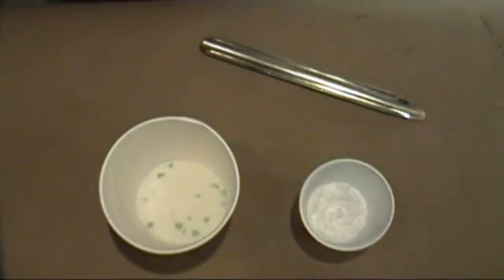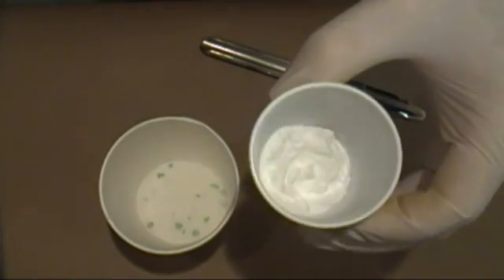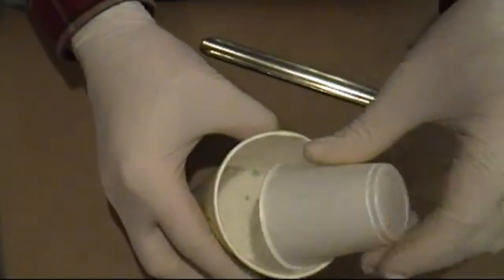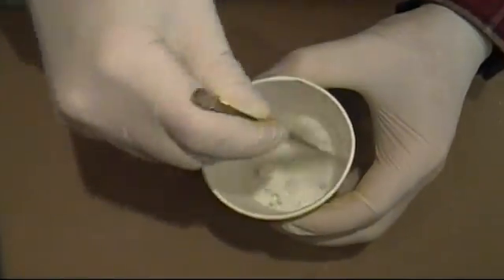Then, get about 30 grams of anhydrous sodium acetate. Afterward, mix them together and then place them in a suitable distillation flask.